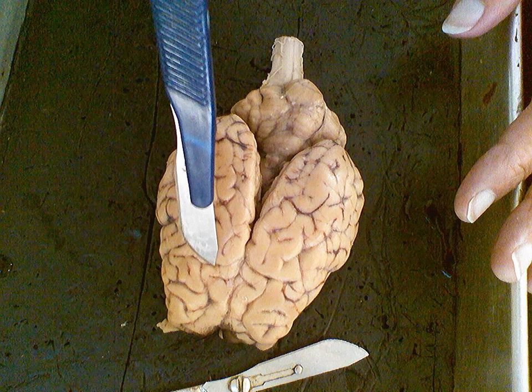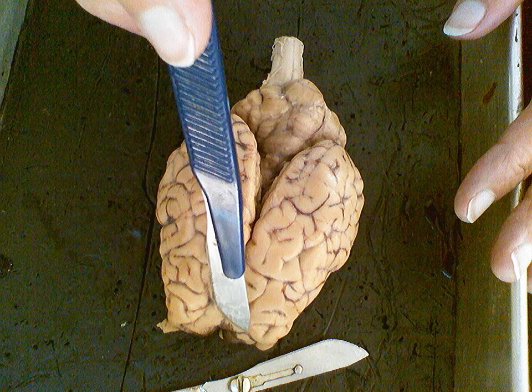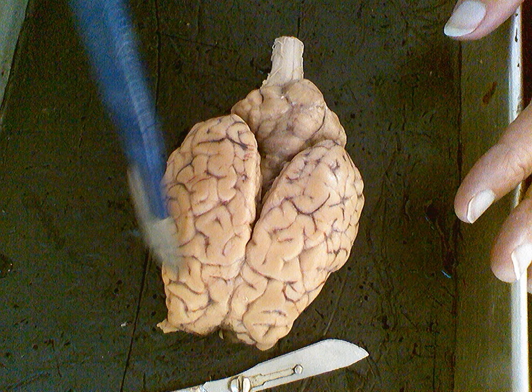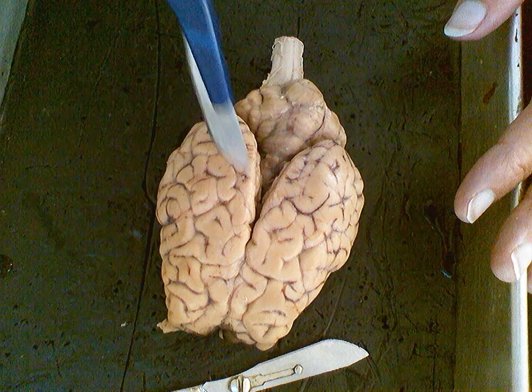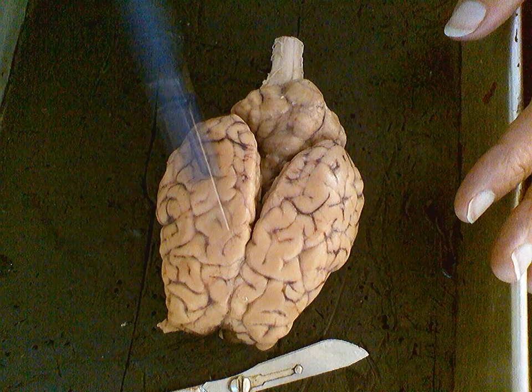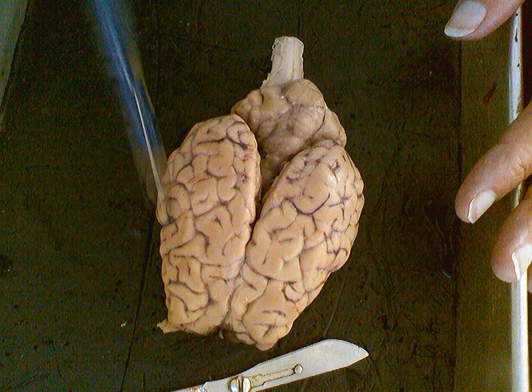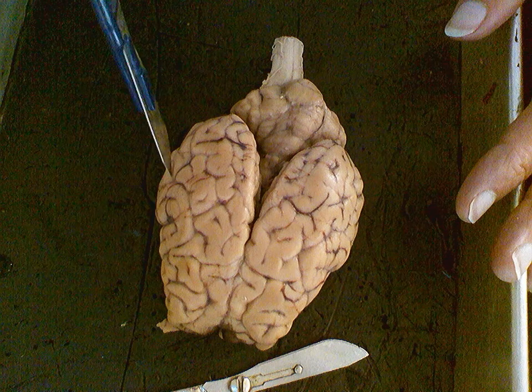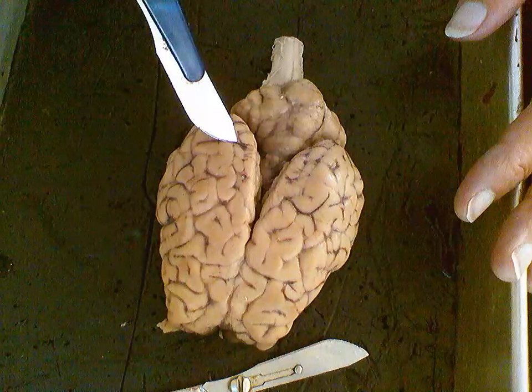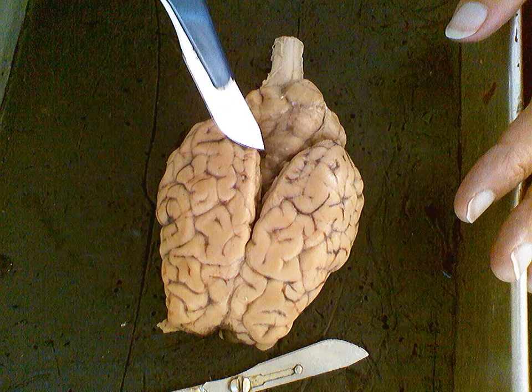And that is a dividing line between the frontal lobe, right here, frontal, and this large area behind it, known as the parietal. If we go lateral to this, then we are reaching into the area we call the temporal lobe. And if we go posterior, continuing posterior or caudally, we are going toward the area of the brain we know of as the occipital lobe.